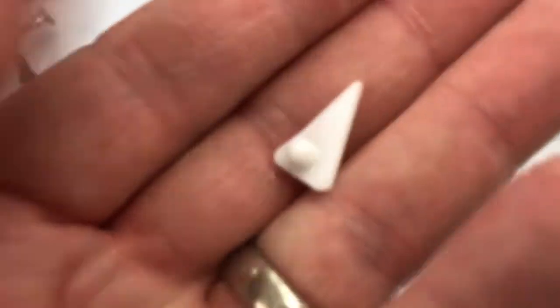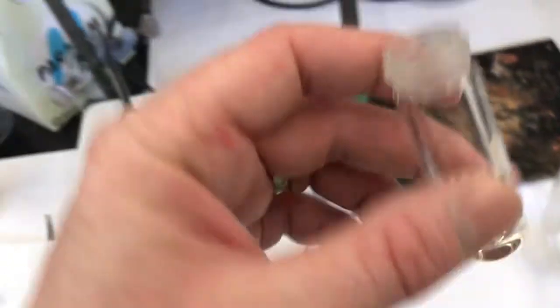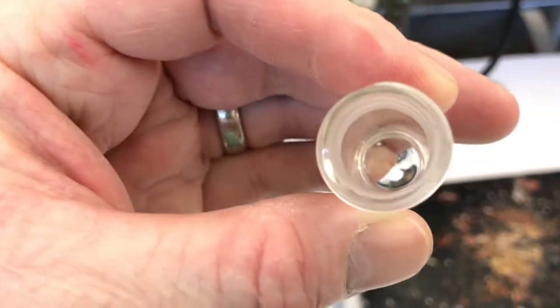It's this Teflon coated magnet in a triangular shape. So the part that sticks out, there's a magnet in there. And you put it in the conical vial, which we call conical because it kind of cones down at the bottom. See how it's cone-ish there? Comes down inside. So you put it inside of here with the most acute angle pointing down.